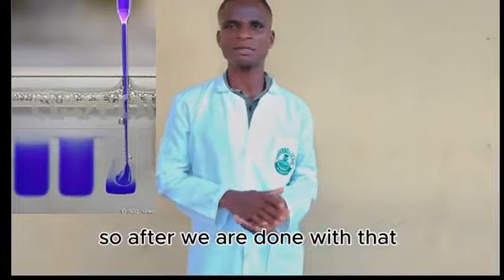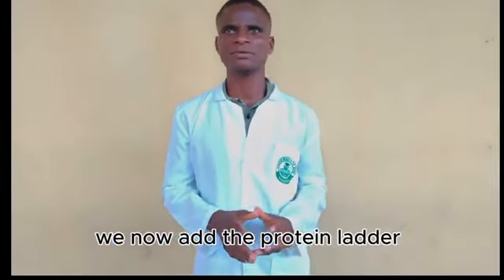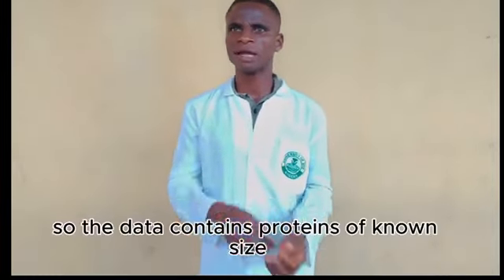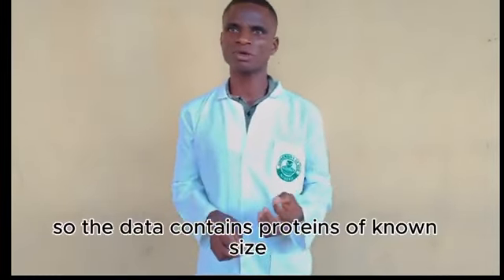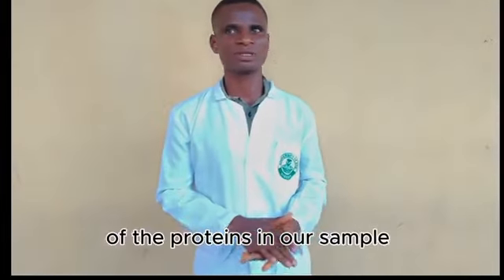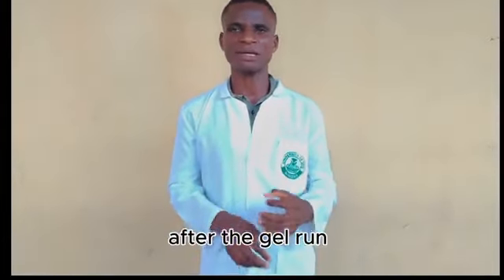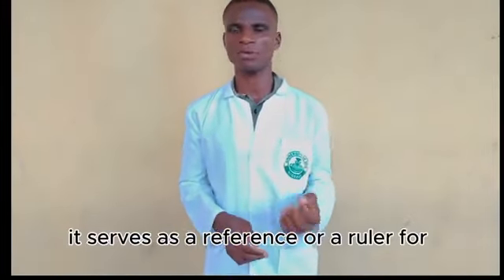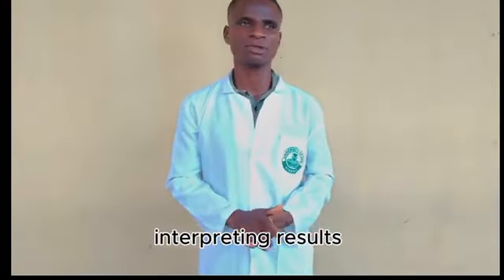So after we are done with that, we now add the protein ladder. Here, the protein ladder is otherwise called the molecular weight marker. It contains proteins of known size. It allows us to estimate the molecular weight of the proteins in our sample after the gel run. It serves as a reference or a ruler for interpreting results.